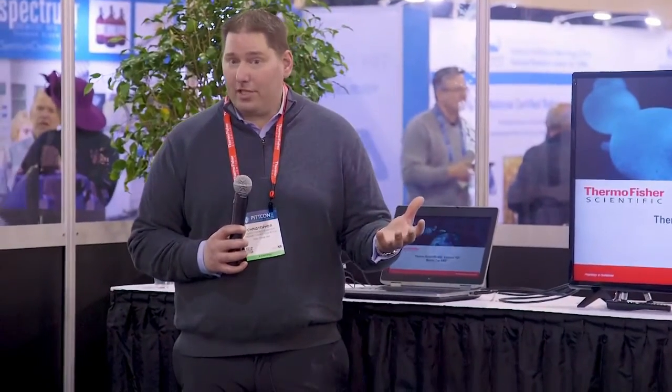System, our benchtop system. I want to go through a first 10 minutes of just theory so everyone understands the principle of X-ray diffraction, and then we'll get into running a live sample and show you how fast it is and how easy it is with our system.